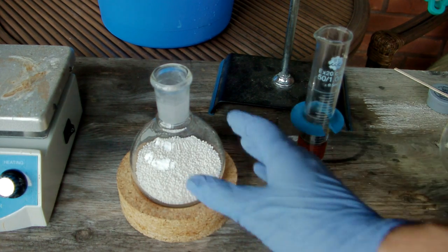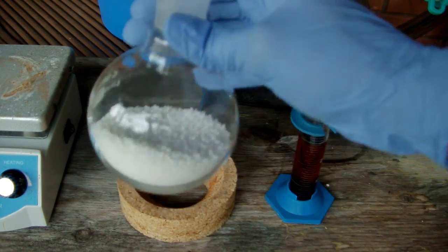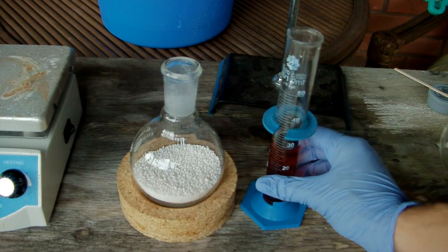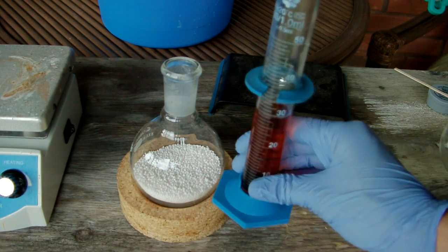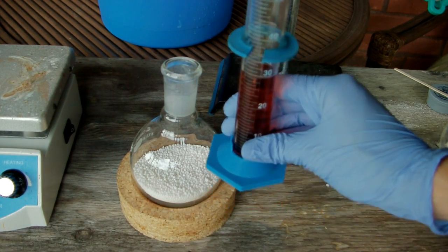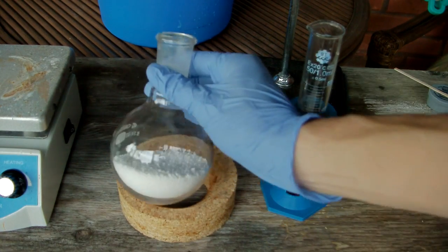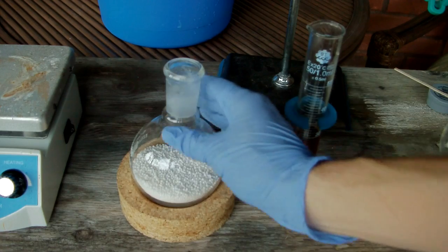What I've got is ammonium nitrate. Here, there's 80 grams of it in prill form, and the stoichiometric amount of 98% sulfuric acid. It's about 30 milliliters. It doesn't look like a lot, so it's not going to cover the prills completely, but we'll see how this works out.